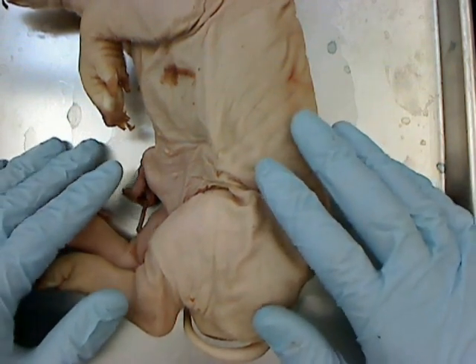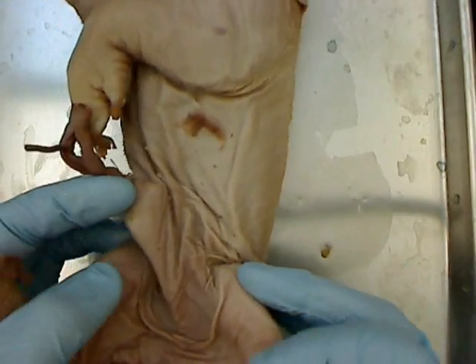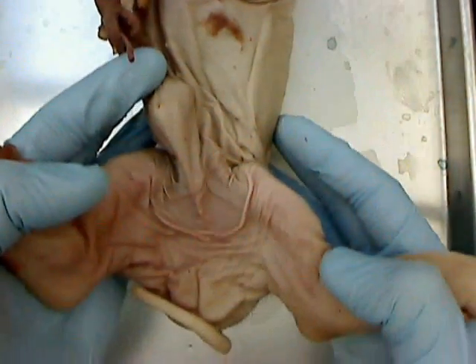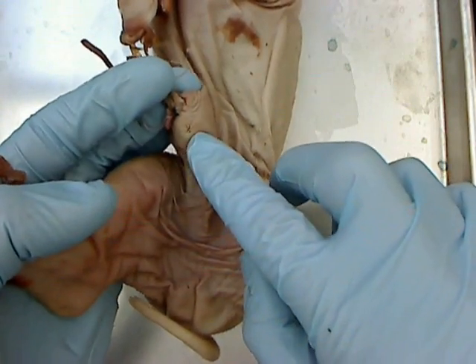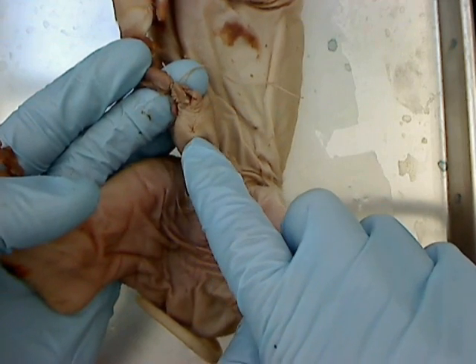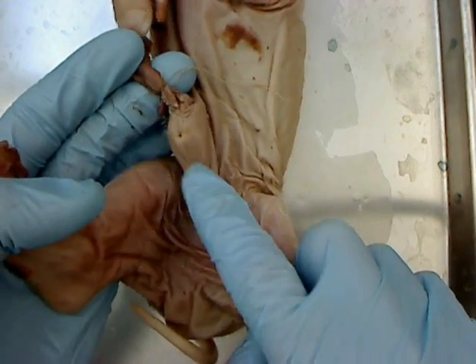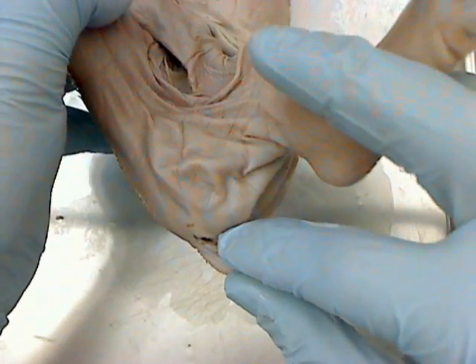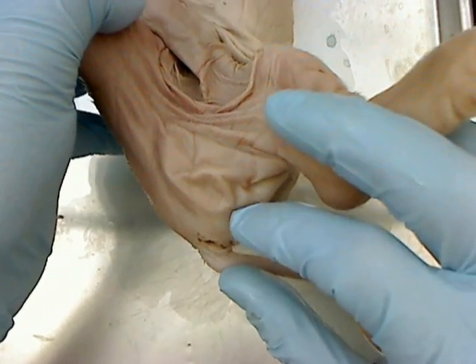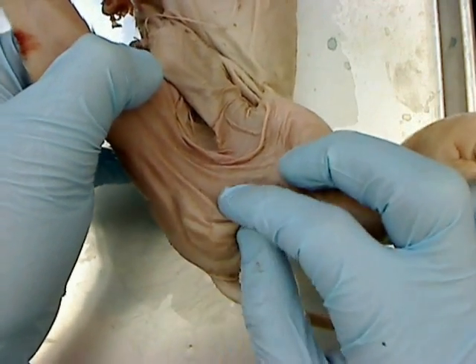For this video, I'd like to show you a male fetal pig for renal and reproductive systems. The way we know this is a male fetal pig, without even opening up the pig, is this little orifice right here below the umbilicus — this is the umbilicus tied off with string. Right below it we have this little opening, which is actually the male urethra, and the penis will be down underneath that tissue as well. Another way you can tell is back here under the tail — you see the anus, but you do not see a genital papilla like we see on the female. And this tissue here is rather loose, because that's going to be the scrotum for the adult male pig.